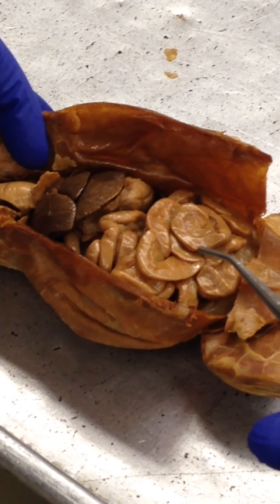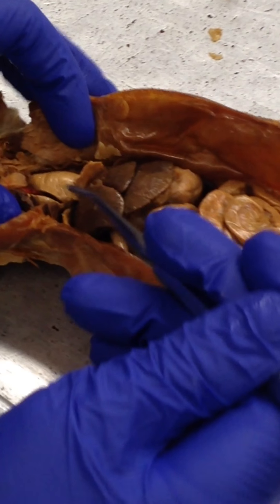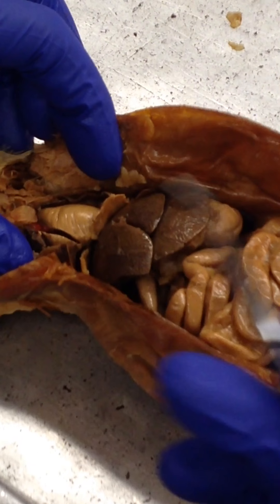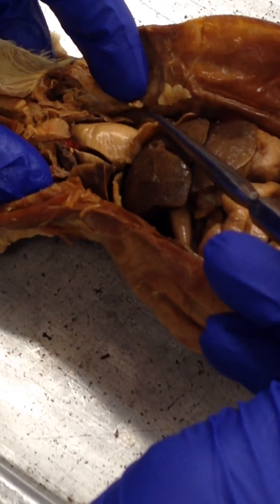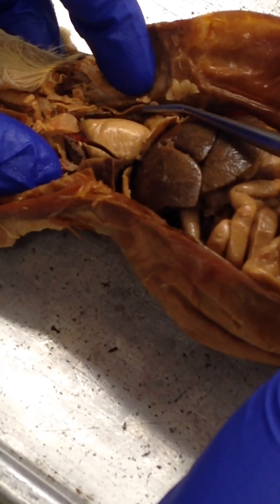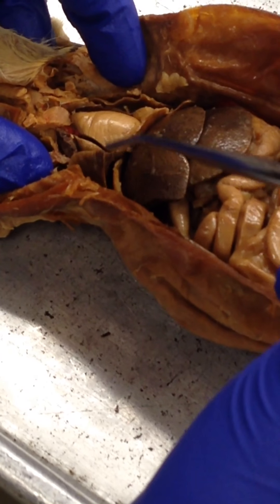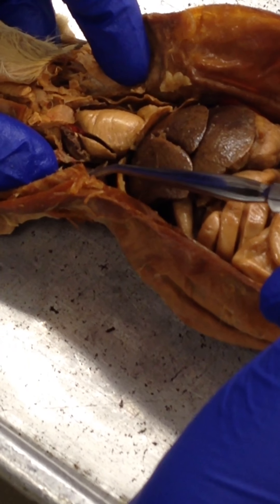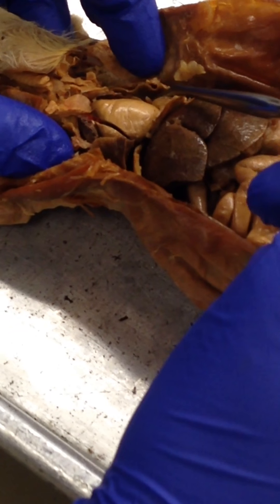The lungs are actually going to be on each side of the heart. So it's these dark brown flaps — this and this.